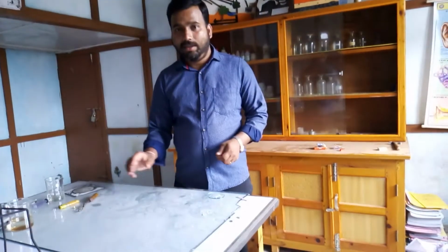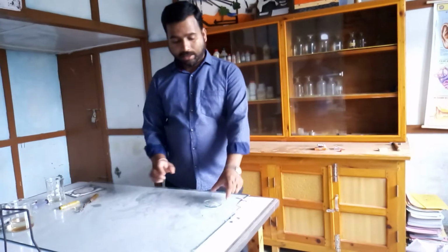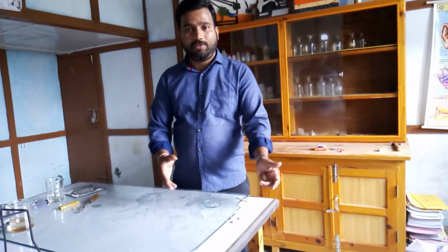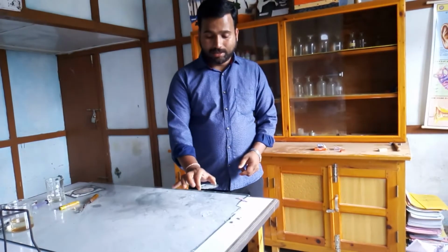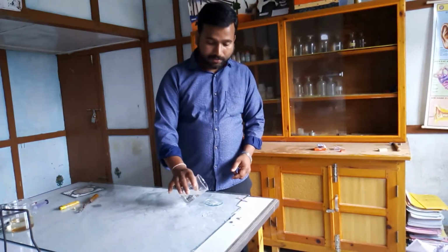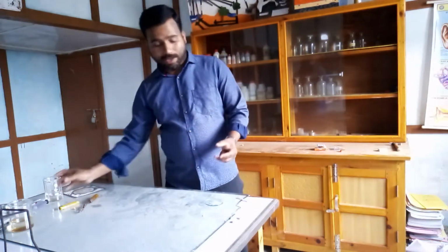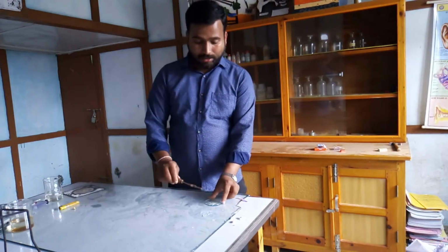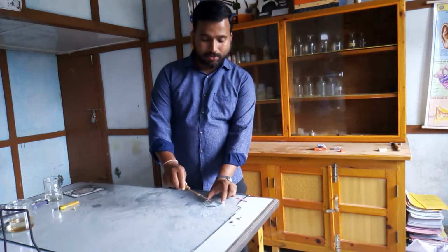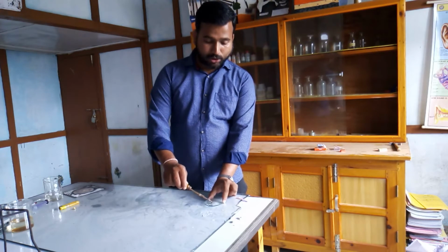Dear students, in this video we are going to see another reaction. The magnesium oxide that we have collected in a watch glass, we are now mixing with a little amount of water. So what is happening here? The magnesium oxide, MgO, is now getting mixed with water, H2O.